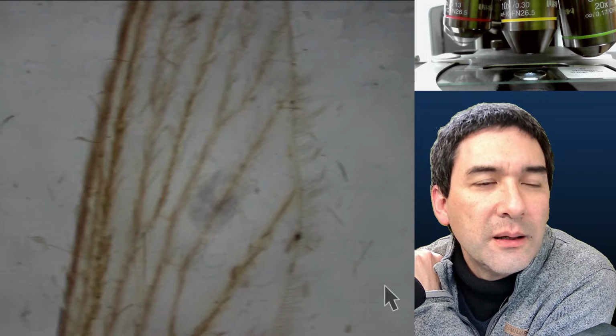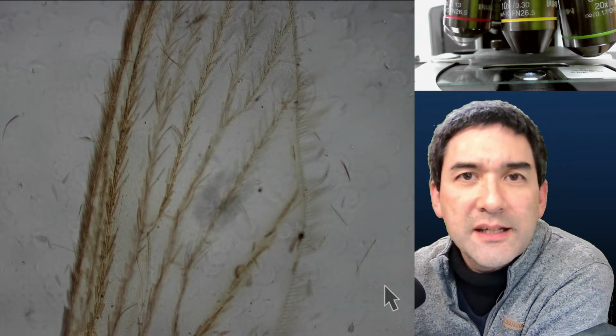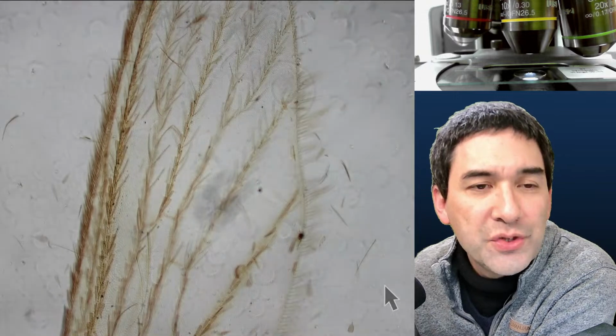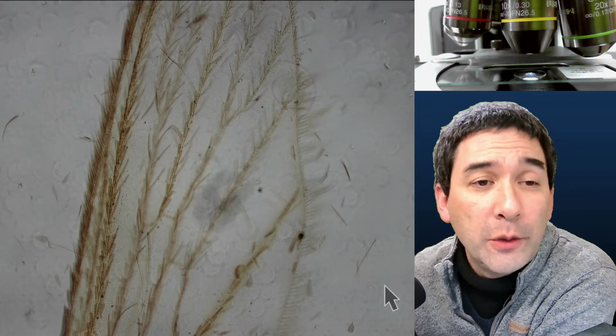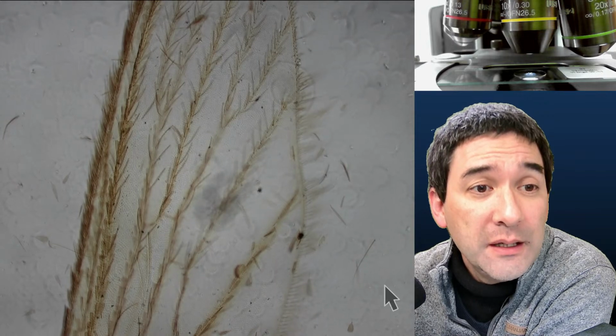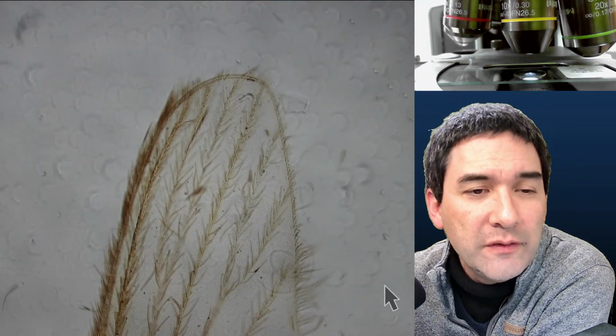So yes. First of all, at the beginning of the video, I said that insects have 2 pairs of wings. Now, mosquitoes actually only have 1 fully developed pair of wings. The second pair of wings is highly reduced so that they're not even wings anymore.